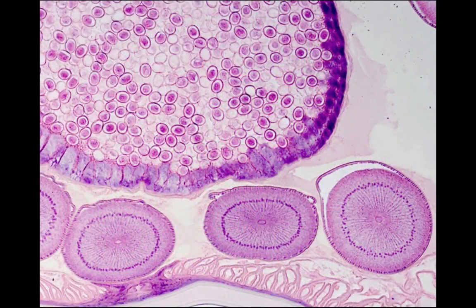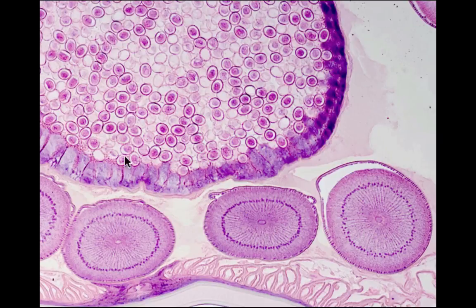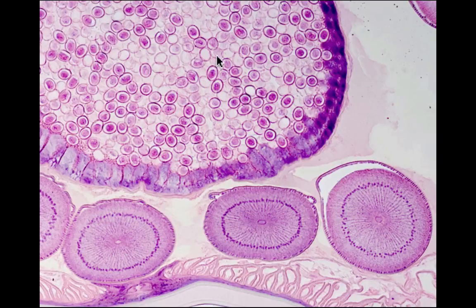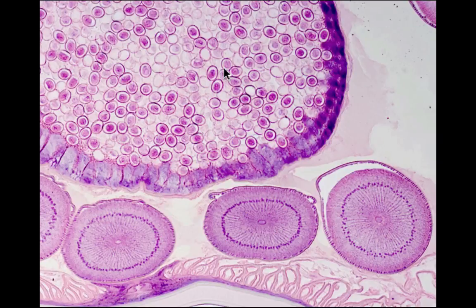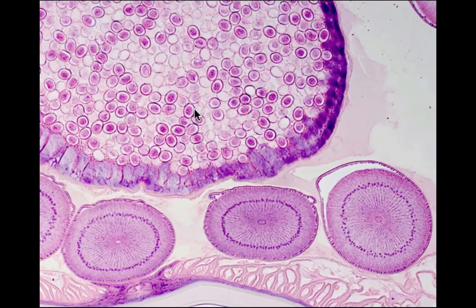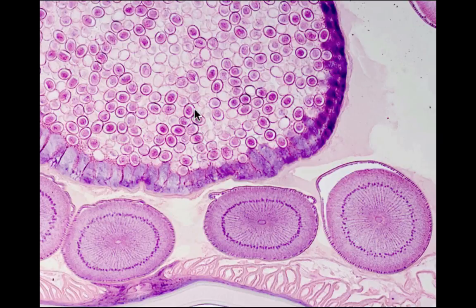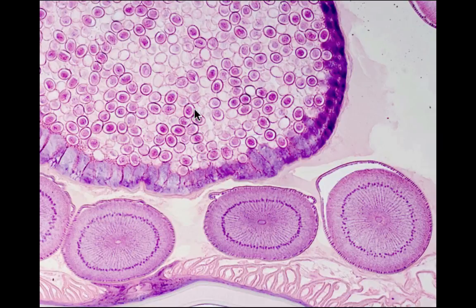This is a higher magnification view of the female Ascaris. Here are the sections of the oviduct along the lower side of the specimen. And this very large tube here is the uterus. Close examination of the cells inside the uterus reveals that each has a shell surrounding it. Just as in birds, the egg must be fertilized before the shell is secreted. Therefore, in Ascaris, fertilization is internal. Sperm are introduced into the vagina by copulation. They travel through the uteri to the oviducts and fuse with the ova. Shells are secreted as the zygotes pass into the uteri. As development begins immediately, most of the cells that you see here are actually embryos.